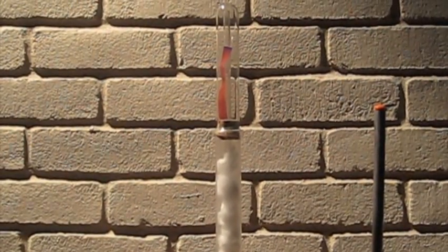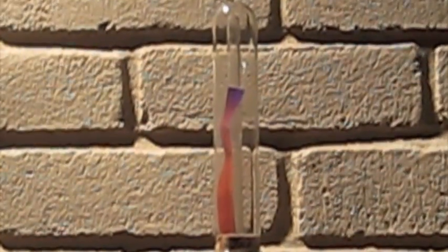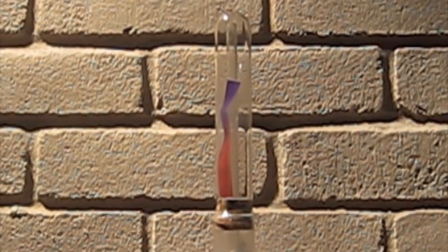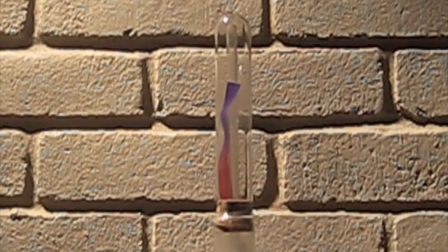I don't know if you can see it, but the very tip of the litmus paper is starting to turn blue. Now you have a better view of it. You can definitely see it's turning purplish blue.